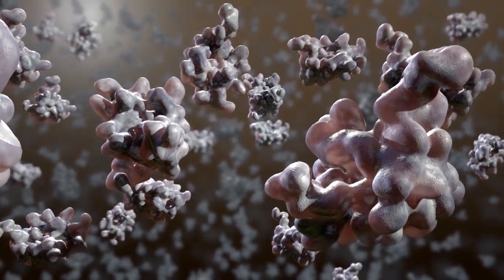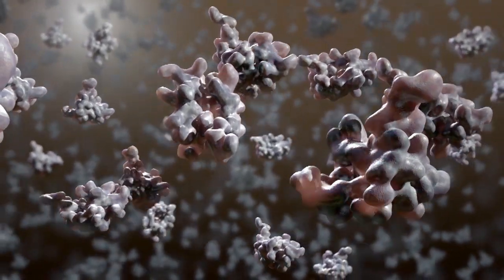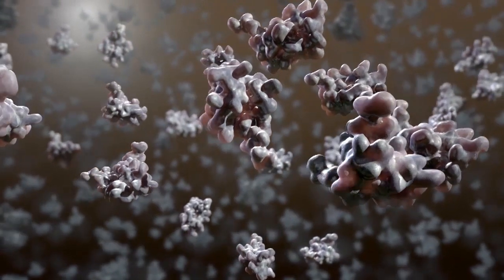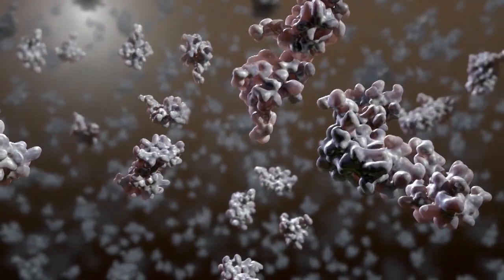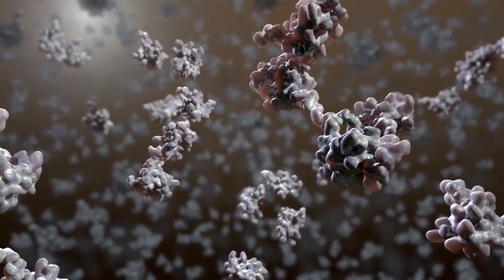Small angle X-ray scattering, or SAXS, is an important research tool in structural biology. It allows us to investigate the three-dimensional structures and structural changes of biological molecules.